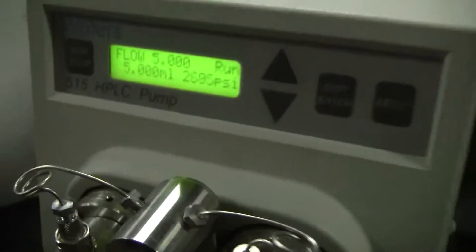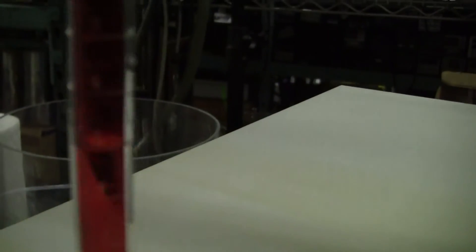Stop. Take it out. Hit run. Stop. And oh my goodness, look at that. We're right at the 5 milliliter mark. Not coming out that well in the... There it is.